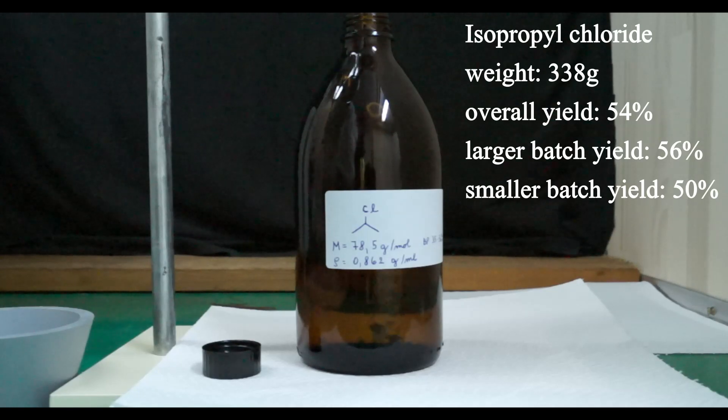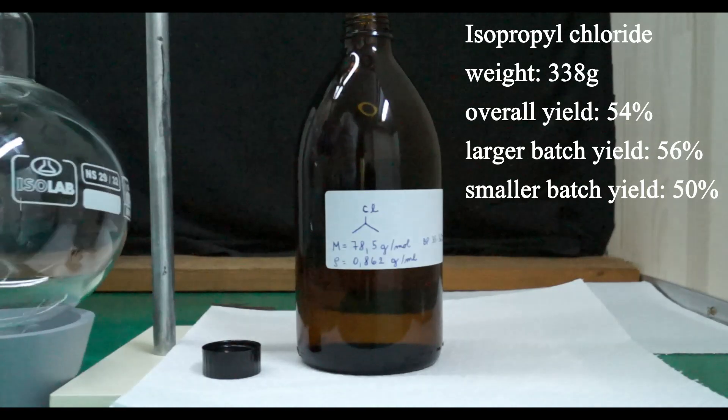This was a decision based on the rate at which the product was distilling but if I wanted to achieve the maximum yield I should have run the reaction until no more distillate came over at the appropriate temperature. But this could have taken several more hours with each hour less and less product coming over.